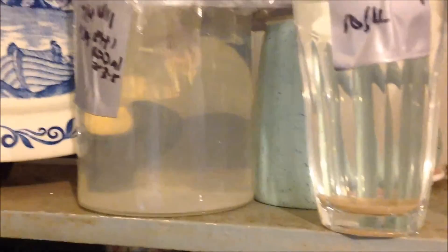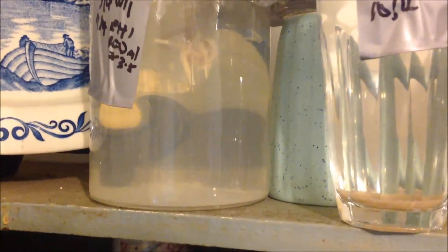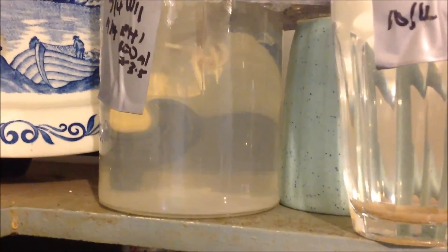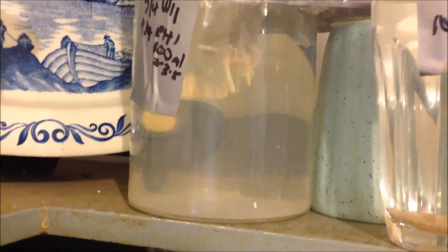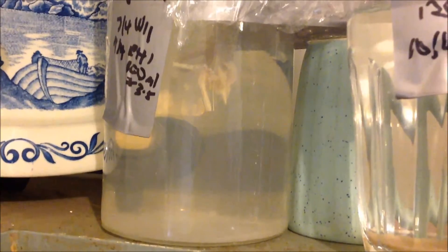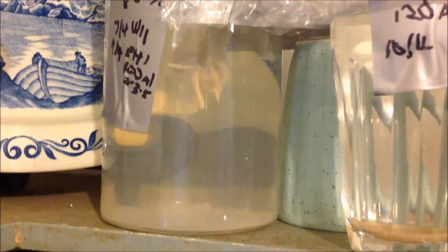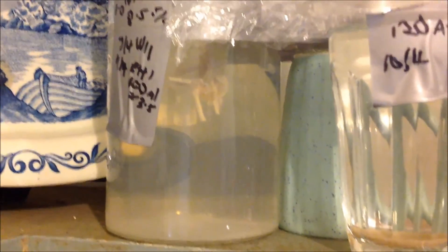At the same time you can see the levels have matched, so from a siphoning point of view there's less fluid coming through. You would have to say that it was coming through and the precipitate was forming in that localised zone quicker than it could dissolve. Intriguingly, I had the idea that it may have even been a tubule — it could have had the precipitate on the outside of a small amount of liquid flowing down. I don't really know that, it's just speculation. But there you have it — I was excited about it so I thought you'd better know.